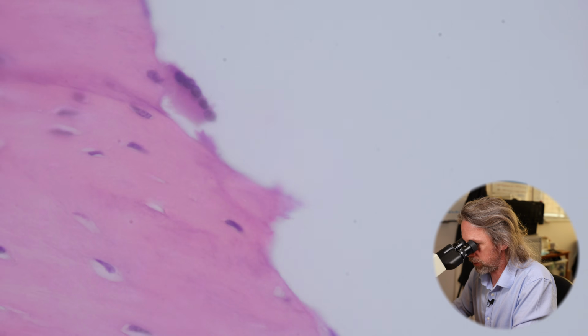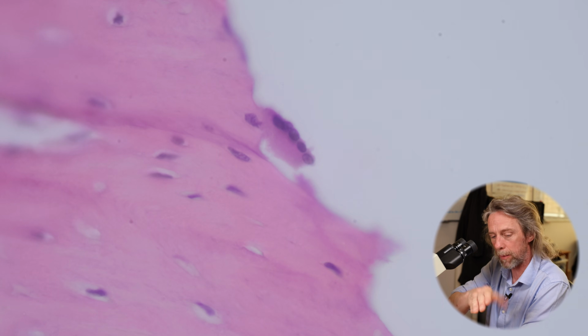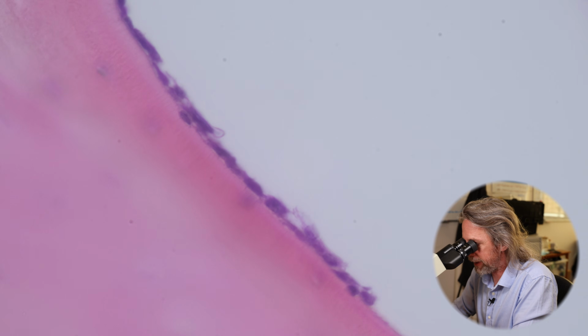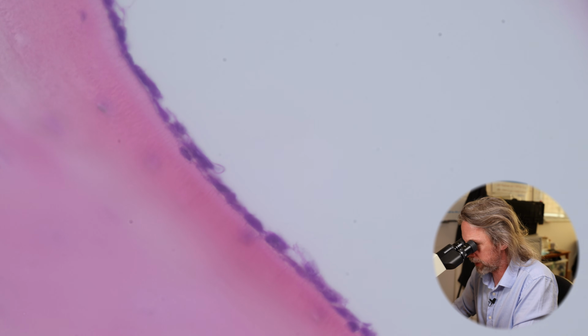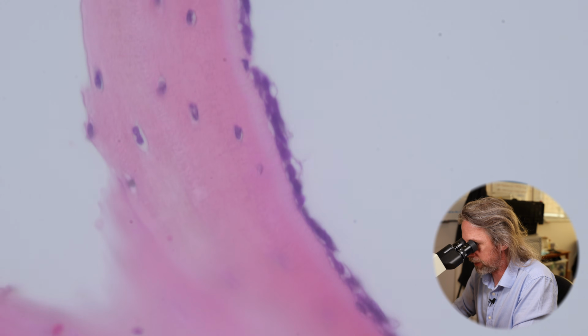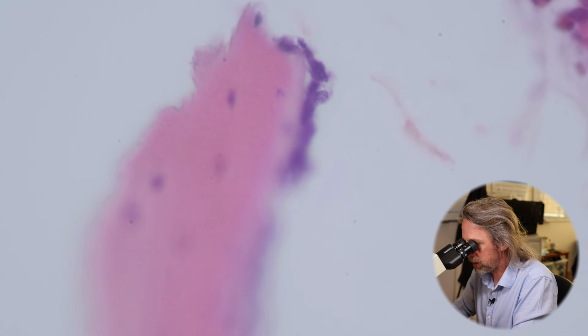Oh, there's a good one as well. Look, 1, 2, 3, 4, 5 nuclei mushed together again. Again, you can see the Howship's lacuna that it's digging for itself. And then here we've got some taller cells. So here we've got osteoblasts on the surface, and they're laying down bone on this spicule, this trabeculum. Oh, we're up against the cut edge of the section there. Okay, so I think that's pretty cool.